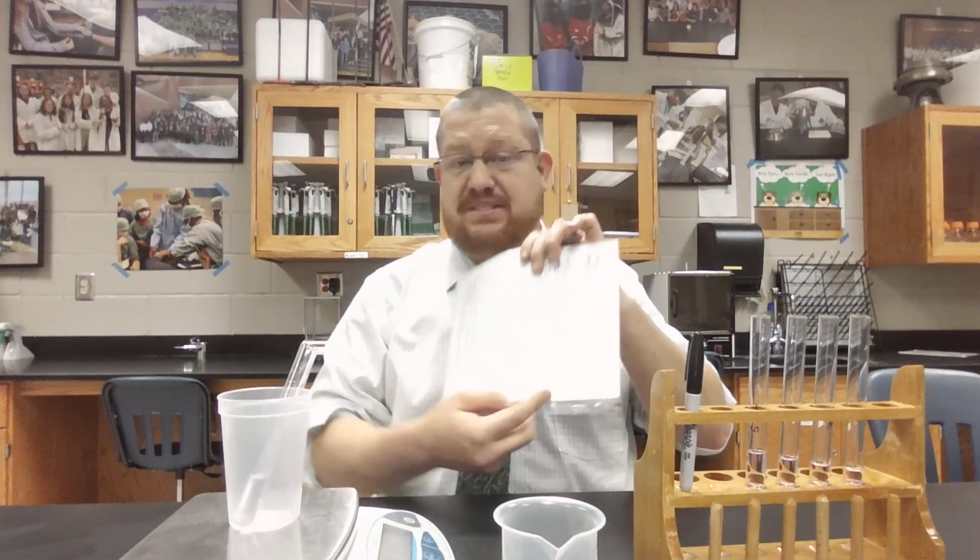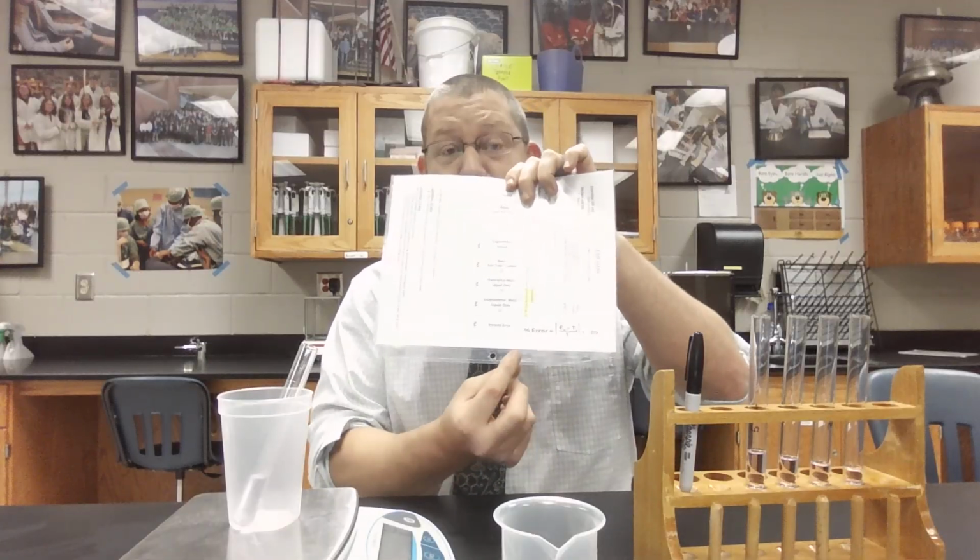And then once we have done that, we will use our percent error formula here, in which we will mathematically see the amount of error we made between our experimental yield, which is what we did, versus theoretical, what we should have gotten based on the density of water being 1.0 grams per mL. And then we discuss that low percent error is good, high percent error is bad. That's what we're doing in the lab today.